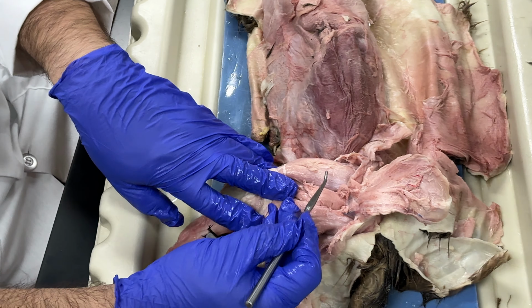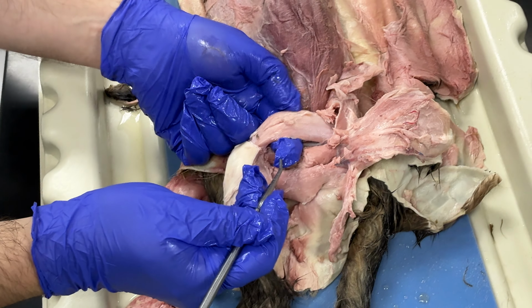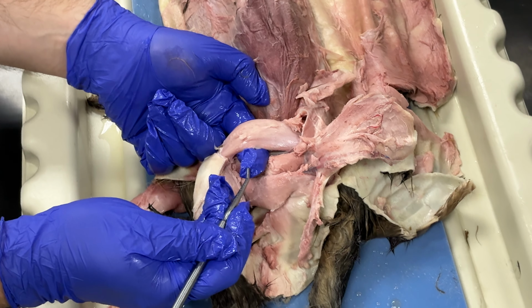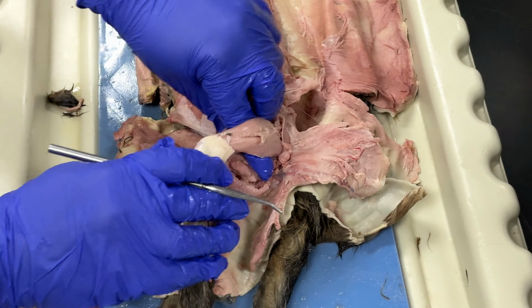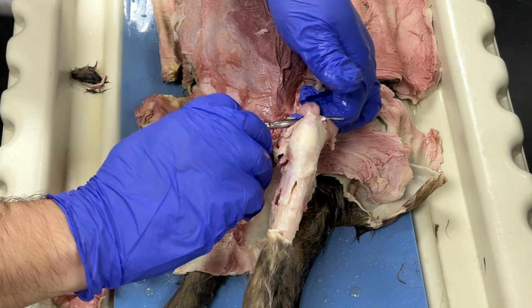And then we have this muscle over here, so all of this is my vastus lateralis. You see my finger is under vastus lateralis. And then this one that my probe is on top of, underneath, this is called the rectus femoris, okay, rectus femoris. And then on the side of that, this is my vastus medialis muscle, all right?